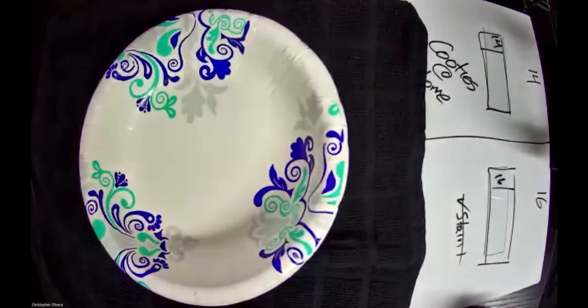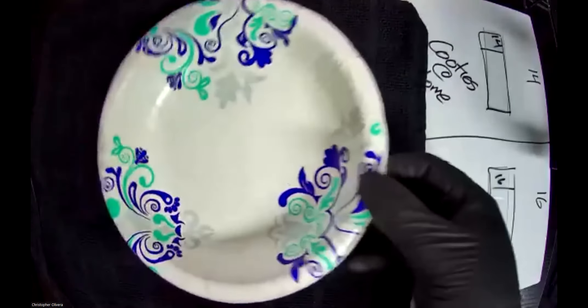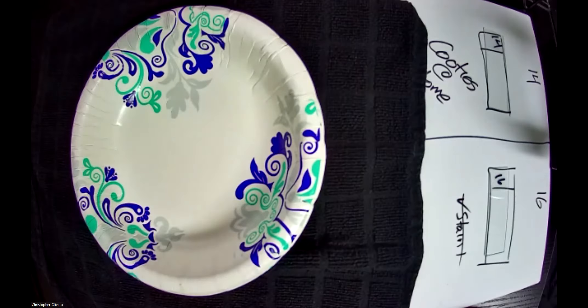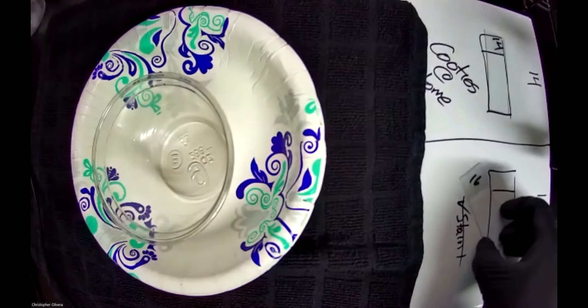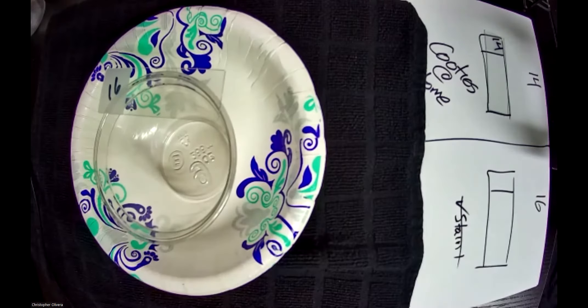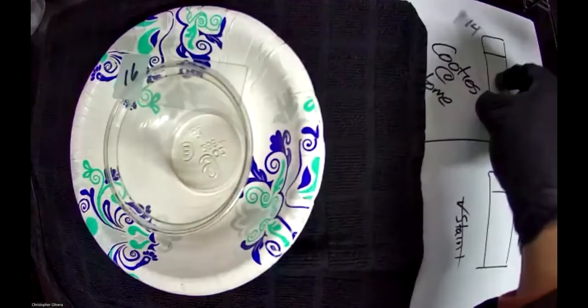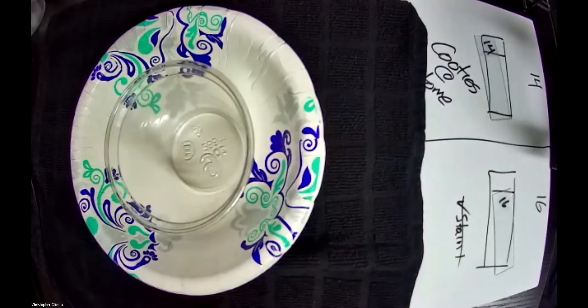I also mentioned you want a catch-all, so I'm using disposable plates — your classic little Dixie bowls that hold cereal and soup. Nothing fancy, I can throw them away immediately. For a receptacle for your slides, I like to use little plastic disposable cups because they fit perfectly. Watch as I use one of my slides — they'll hold them really well — and you can put both of your slides right in there.